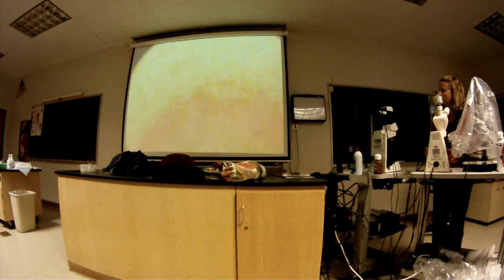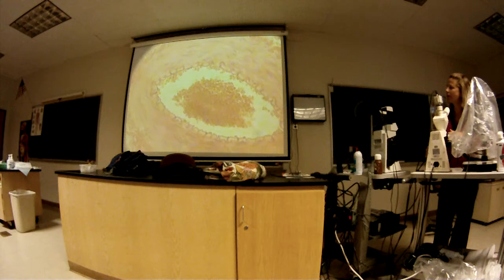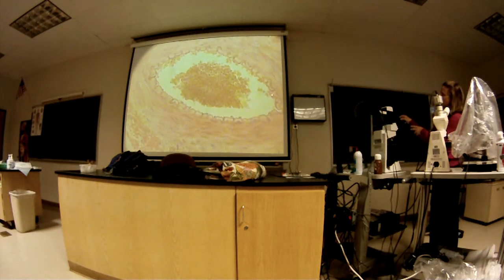Okay, so then the outermost layer, what's this one called here? Yeah, adventitia. That's a dense fibrous connective tissue. We'll go over that a little bit more when we cover blood vessels as well. And what about the name of this very thin layer? Is that the endo? Well, what's the name of the main layer? It should be more specific. Yeah, the intima or tunica intima or interna. Same thing.